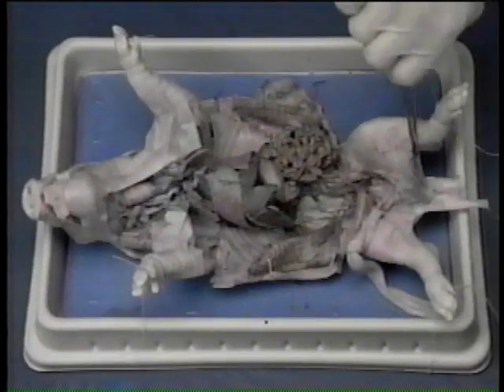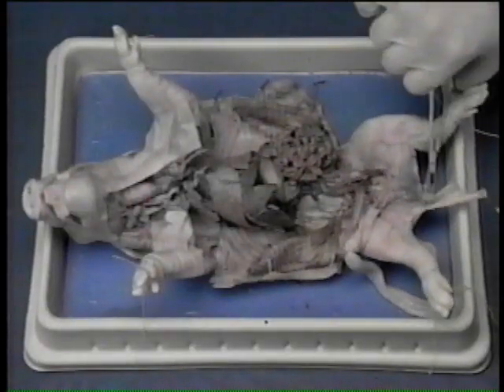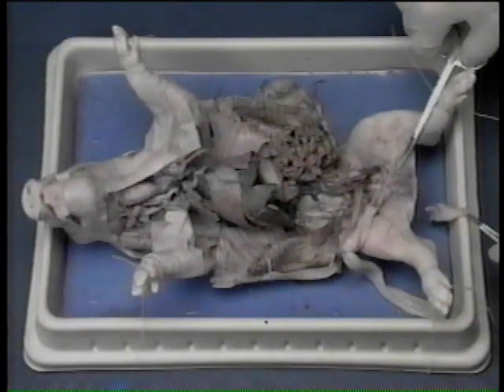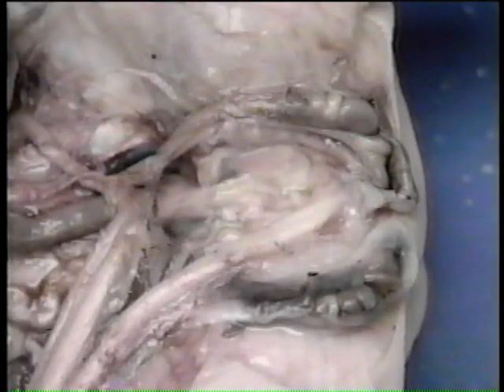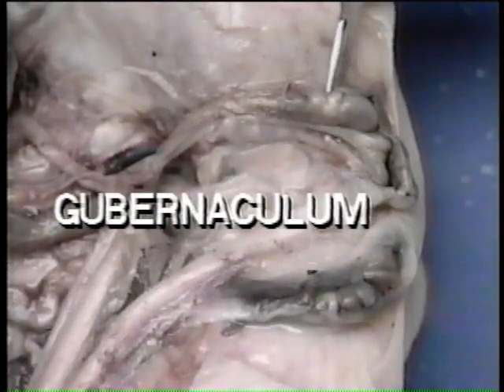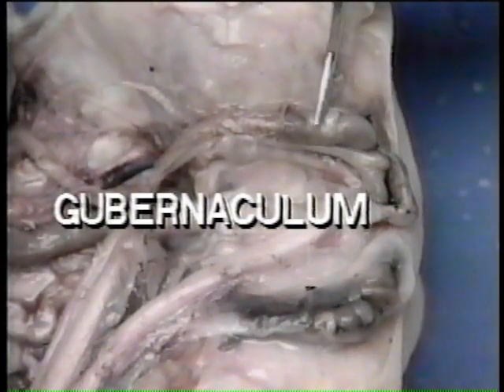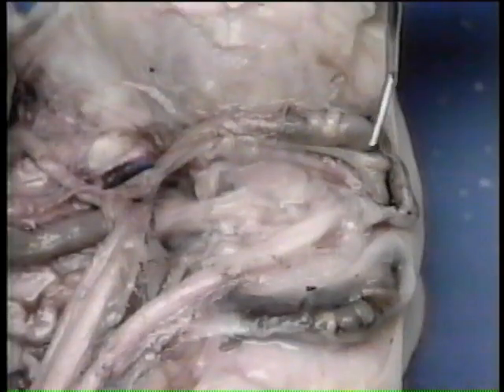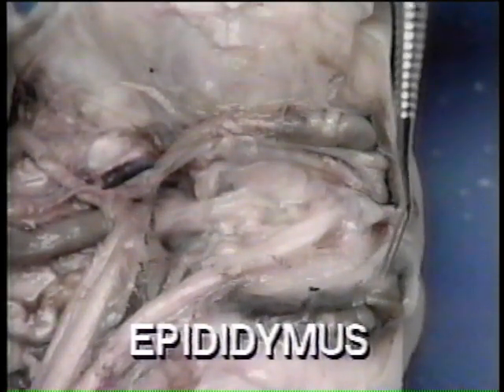Locate the scrotal sac. Slit the scrotal sac and pull out the dark-colored sac. Remove the sac to expose the testes. The gubernaculum is the tough white cord situated at the caudal end of the testes. The epididymis appears as a tightly coiled mass of tubules.